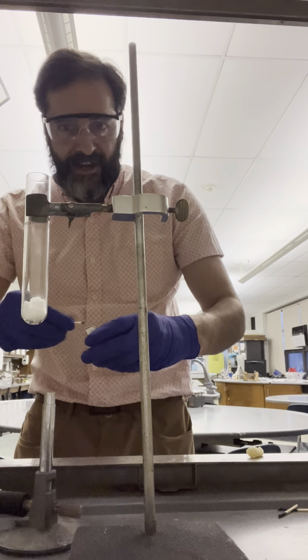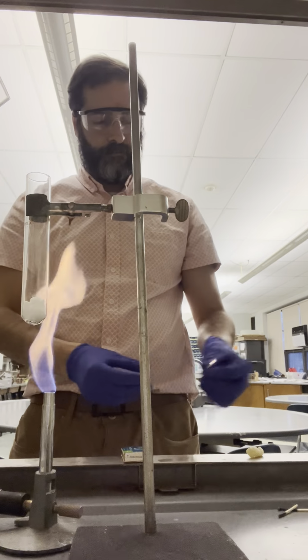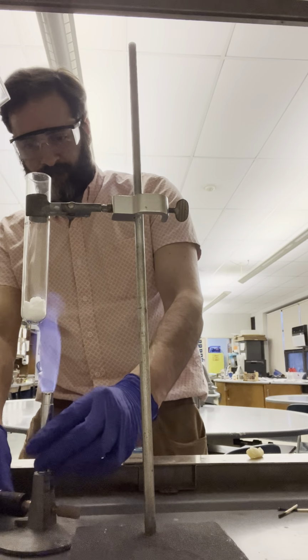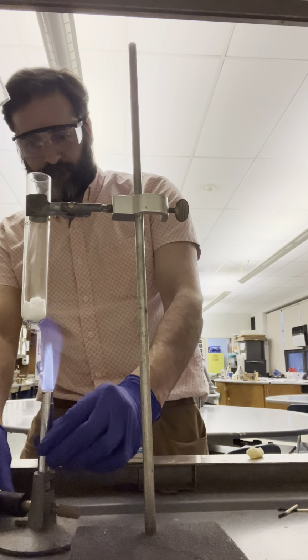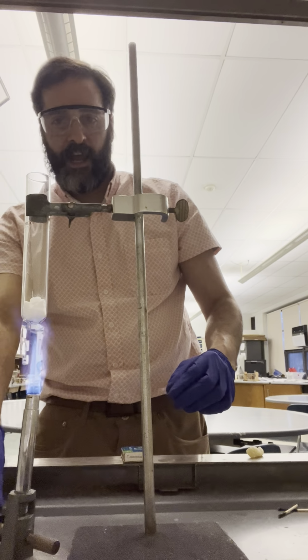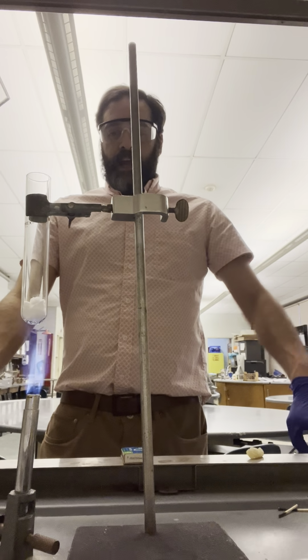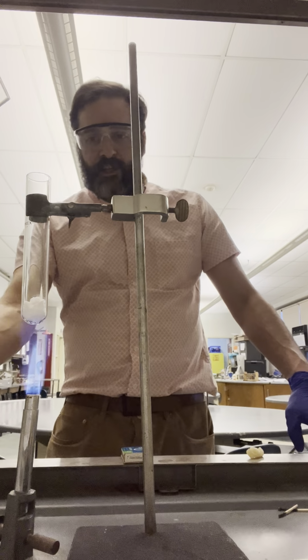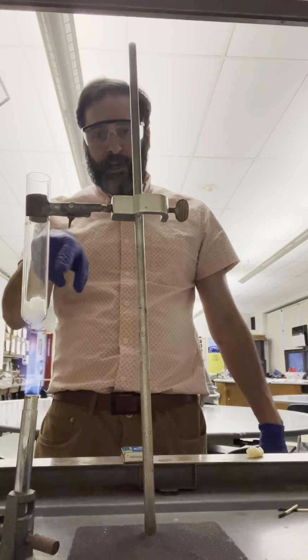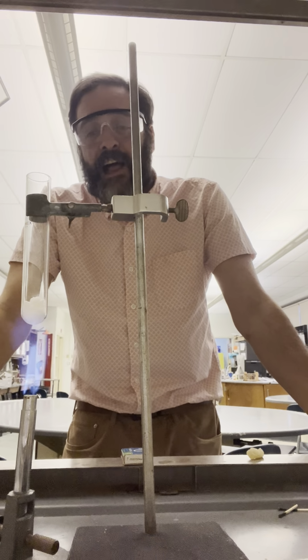The vent sucked out. Try it again there. Okay, so the first thing you should be looking at, you will see the actual crystals start to melt into a liquid at the bottom. This white powder will turn into a clear liquid. It'll look a lot like water.